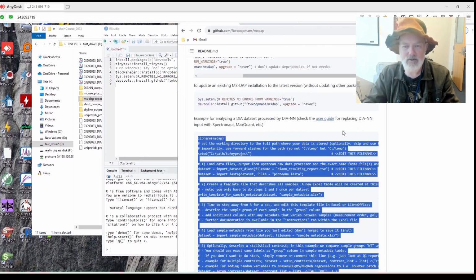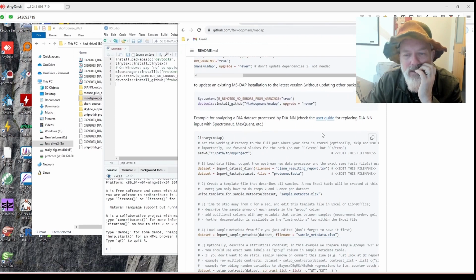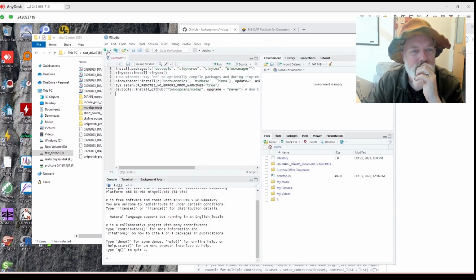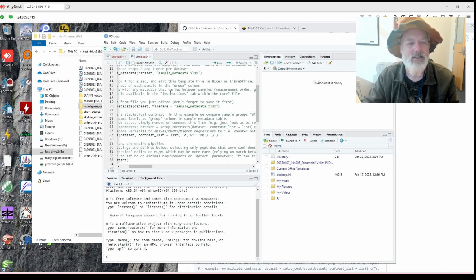I'm going to click this little button again to, let's see. Okay, we don't need that. We're going to copy that over, and we're going to hit new file, new R script, and paste it in here.